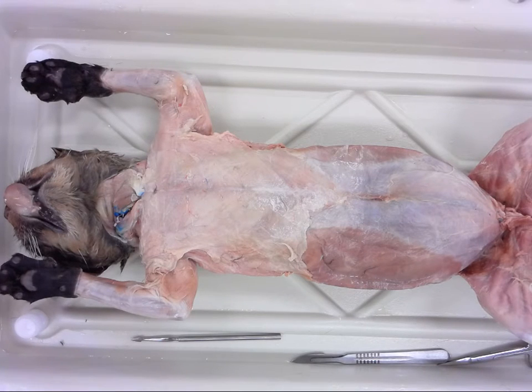One of the best recommendations that I often have for students is that when you get out your specimen, you review anything that you had done before or anything that you have dissected out. That is going to help as we build upon things, so that you're not going back and trying to cram in a whole lot of things at the end.